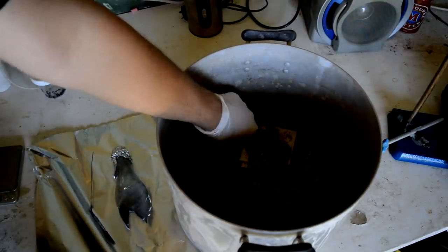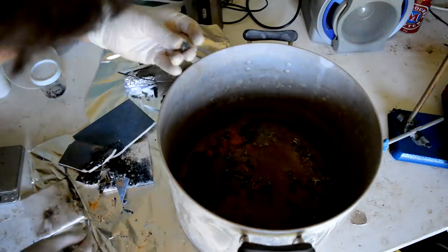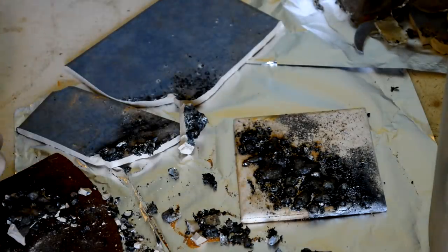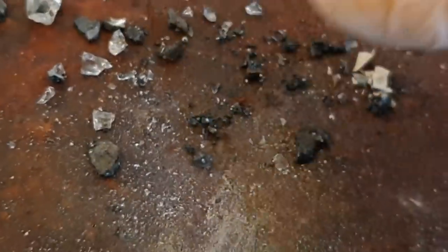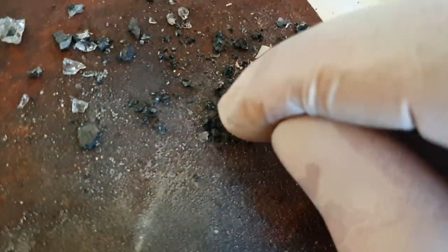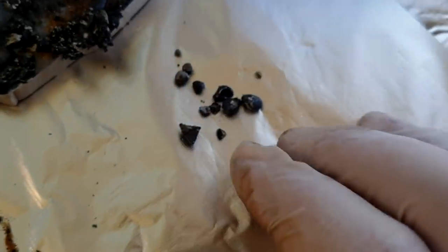Now I'm going to have to wear gloves to pick through this. Yeah, so this is a problem — you can see each tiny little silver bit of metal is vanadium, but it's tiny, tiny, tiny. It hasn't really coalesced. So if I have this bit of slag here for a piece like this, it's very hard to pick that out. There are some bigger amounts, but I'll keep collecting them and show them off.